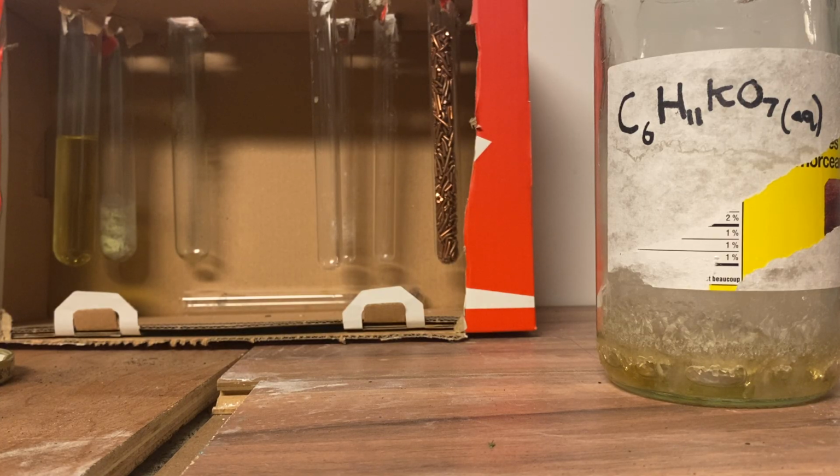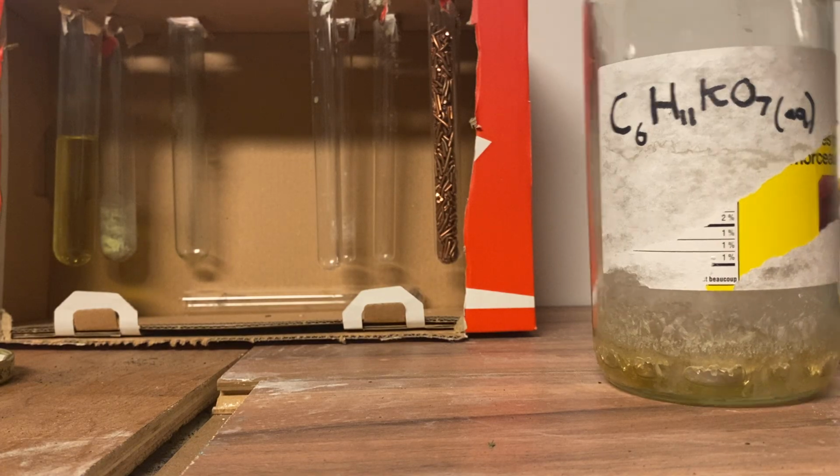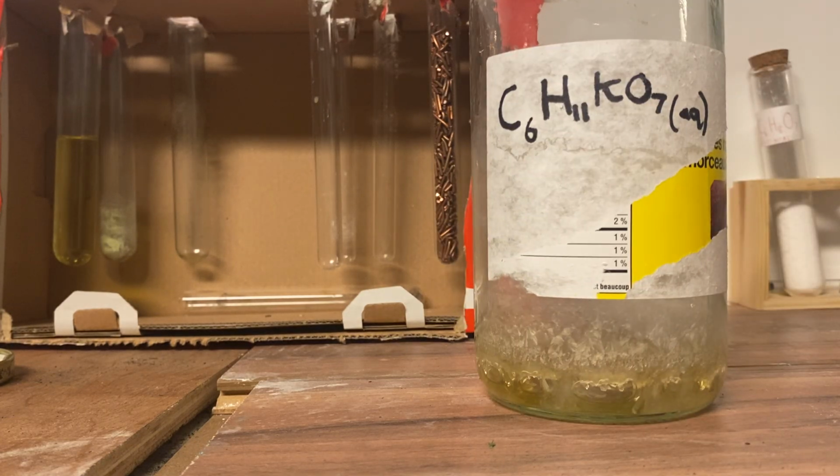And that's pretty much the end of this video. I just wanted to show you guys how I was able to get this potassium gluconate, and you guys can do the same probably by doing the steps that I said in the beginning.